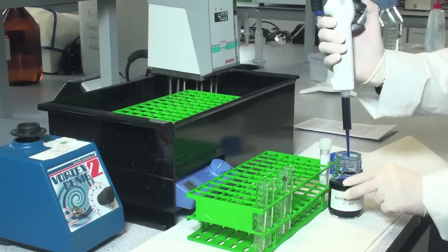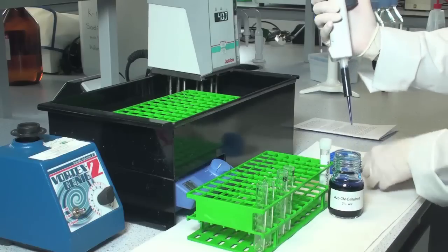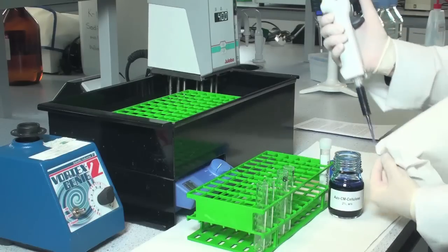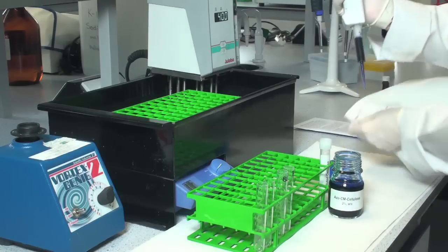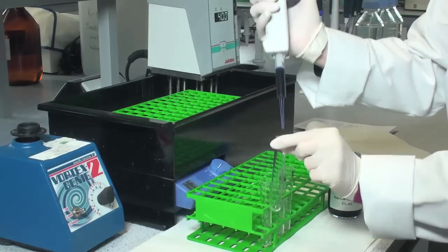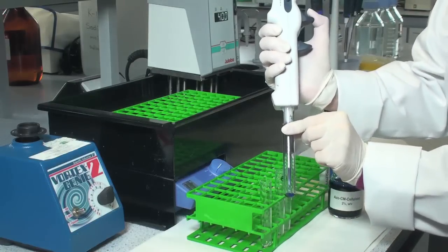The solution is viscous so use a positive displacement dispenser, remove excess liquid from the tip of the dispenser and then transfer the solution to the tubes, preferably to the bottom of the tubes.